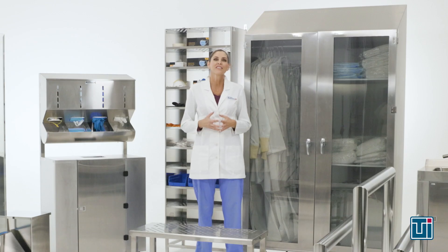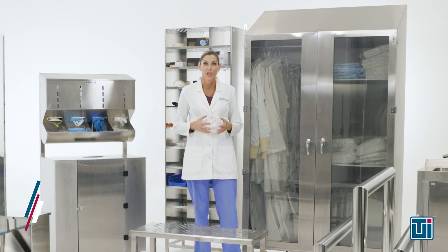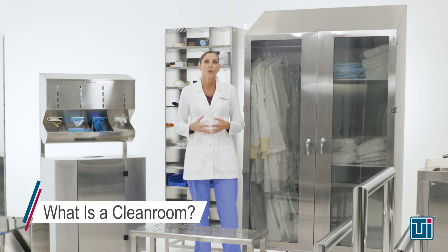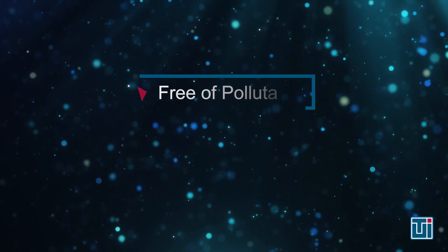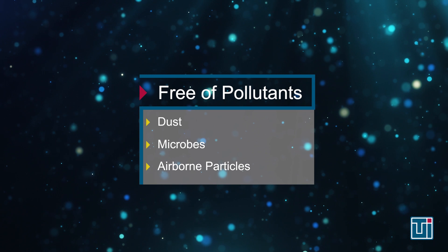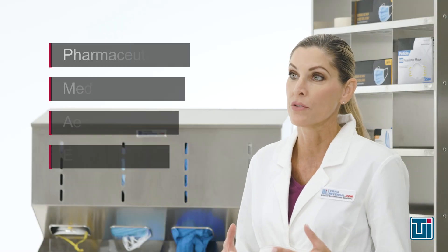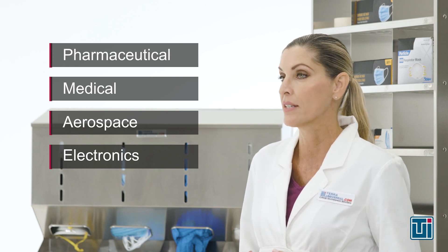First, let's define some of the terms referenced in this video. What is a clean room? A clean room is a controlled, isolated environment devoid of pollutants like dust, microbes, and airborne particles. Clean rooms are designed to house manufacturing or R&D operations in the pharmaceutical, medical, aerospace, and electronics industries.